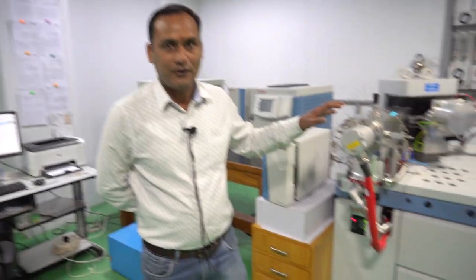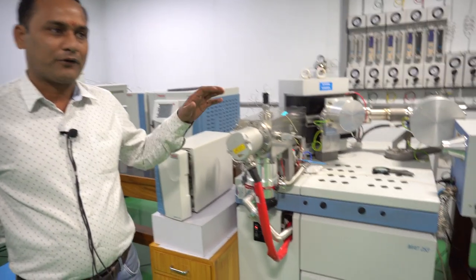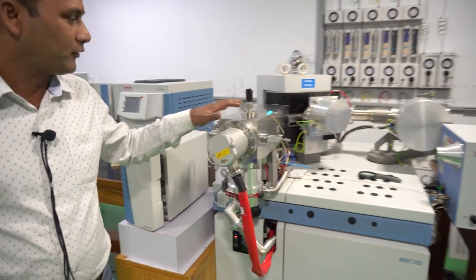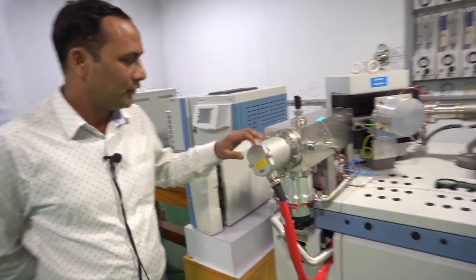Hello everyone. Last time I gave brief information regarding isotope ratio mass spectrometer. Now here I would like to show you the main instrument and provide information regarding the fundamentals of isotope ratio mass spectrometer.